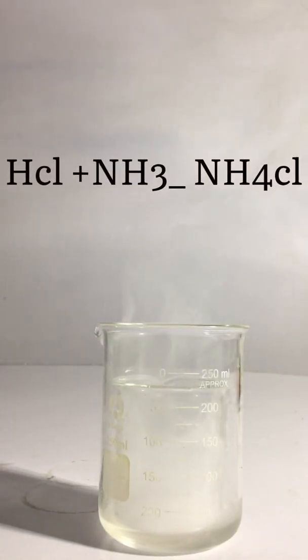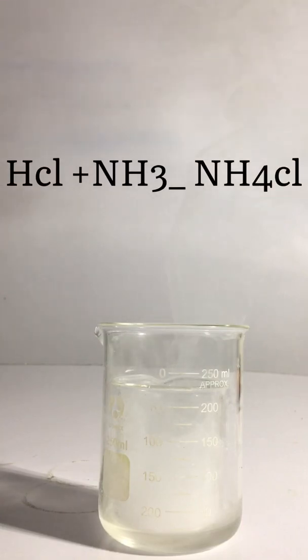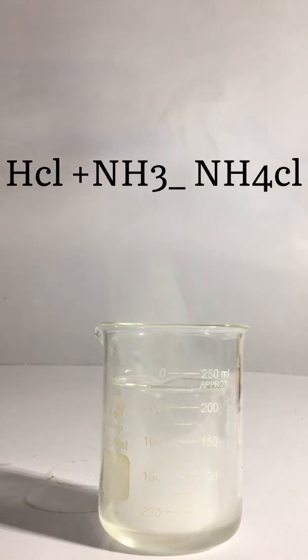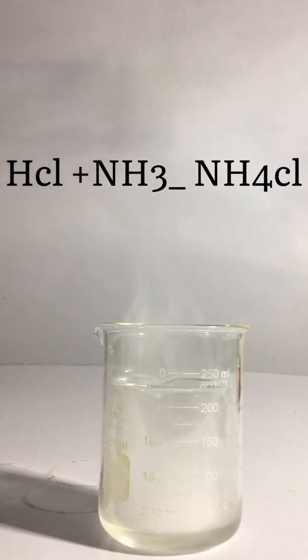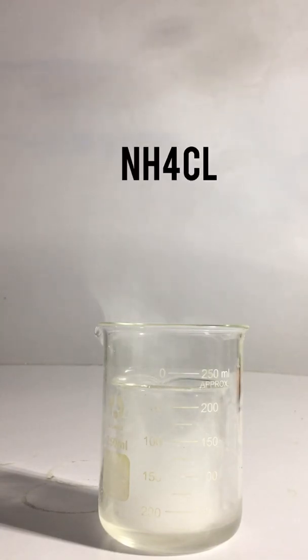The reaction will start, resulting in the formation of ammonium chloride — a salt formed by the combination of ammonia with HCl. The fumes that you can see are actually ammonium chloride formed from this chemical reaction.